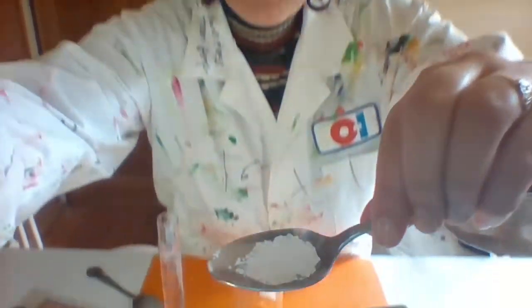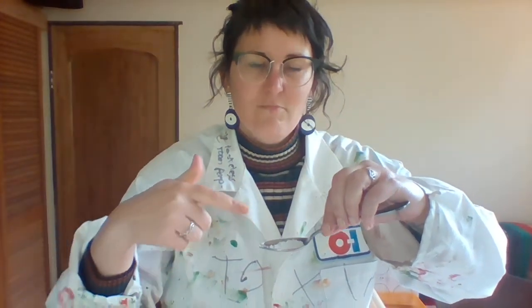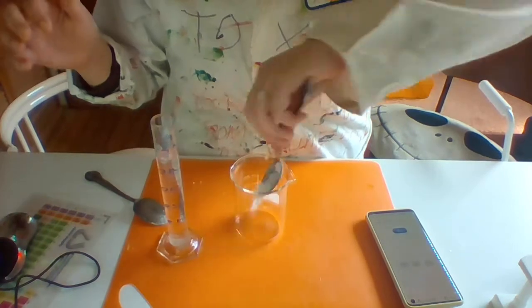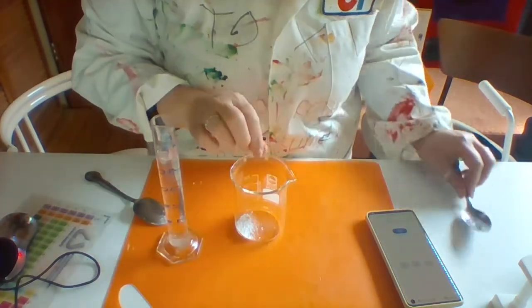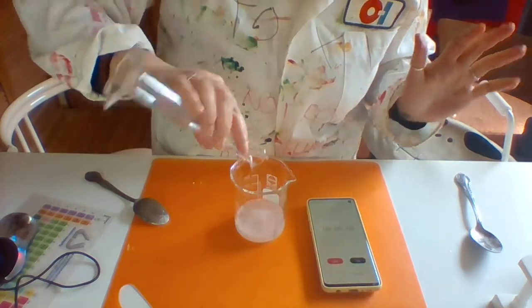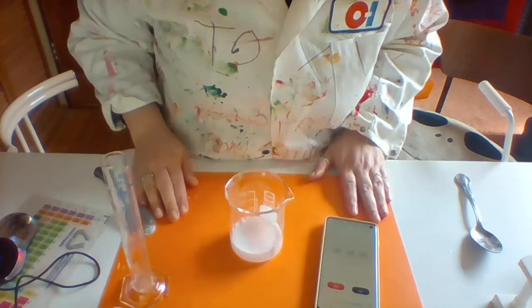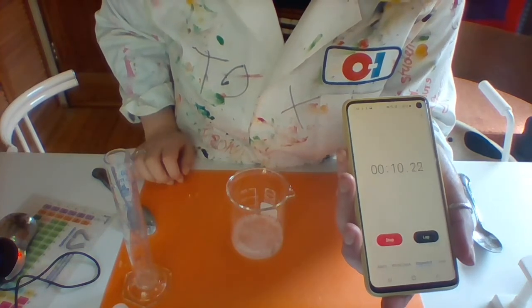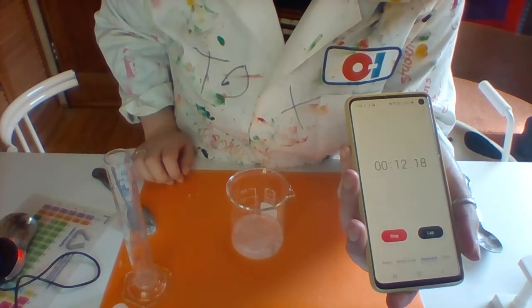So now the final surface area test. I have crushed it up, as you can see, so this has a very high surface area — lots of surfaces in this powder. I'm going to put it in. And it's done.